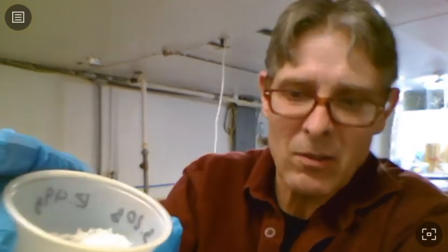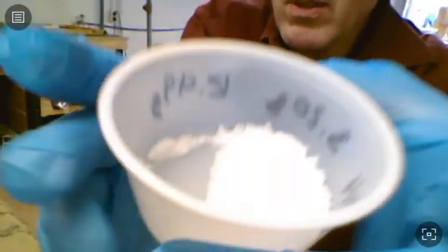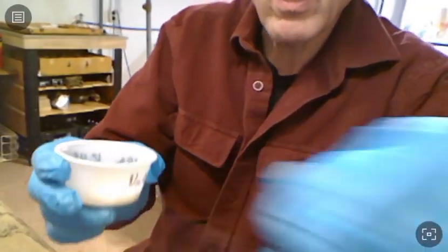Something about sodium hydroxide is it's very hydrophilic, so it even clumps. I don't think you can see here very well, but if I turn my camera down, you might even be able to see that it's already starting to clump a little bit around the edges in my cup. So that'll also happen whenever we just try to dissolve it into our solution. Sometimes it'll kind of clump and it's a little slow to go into solution.